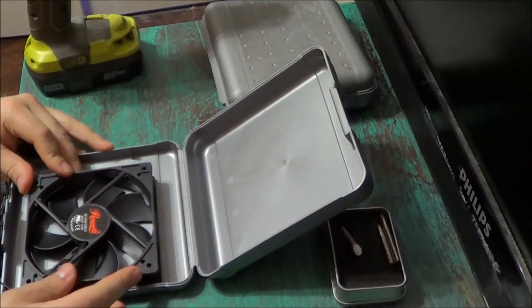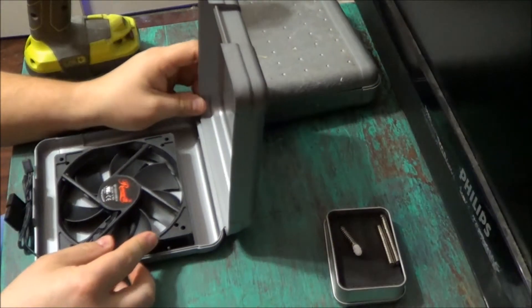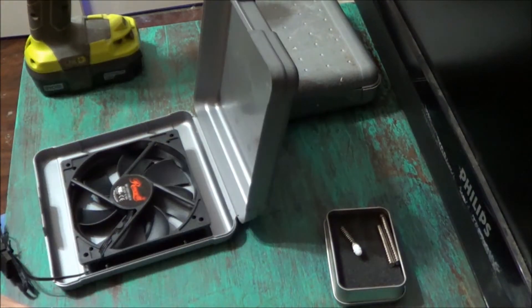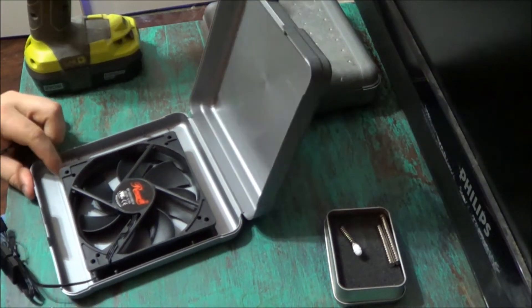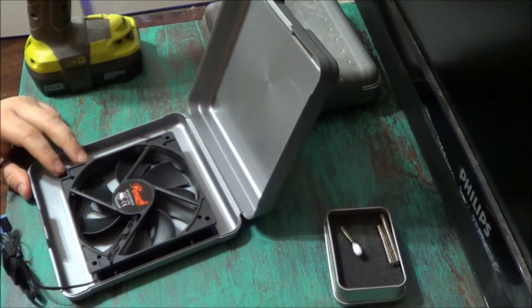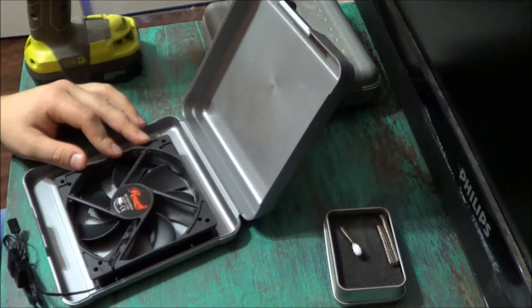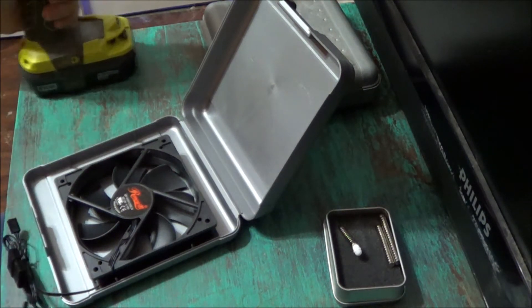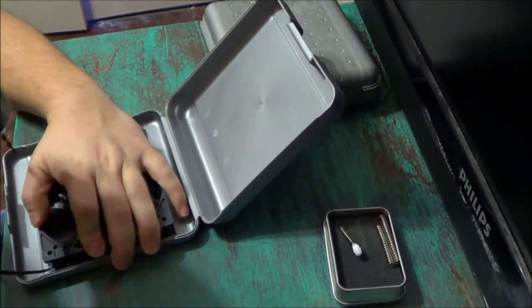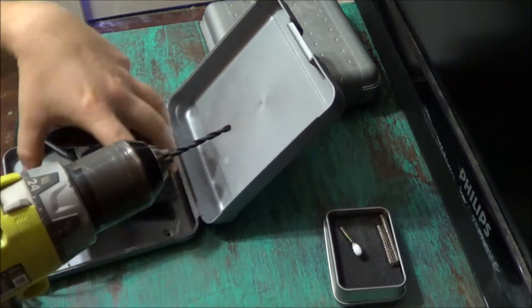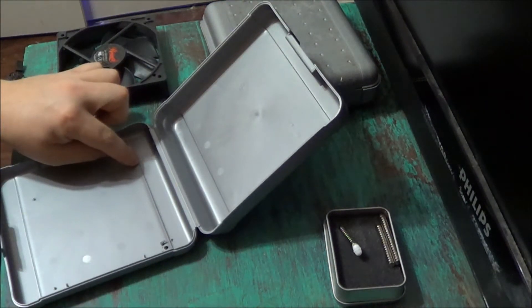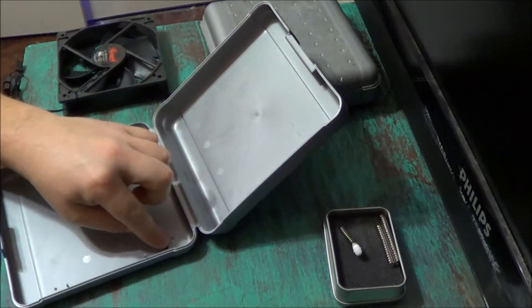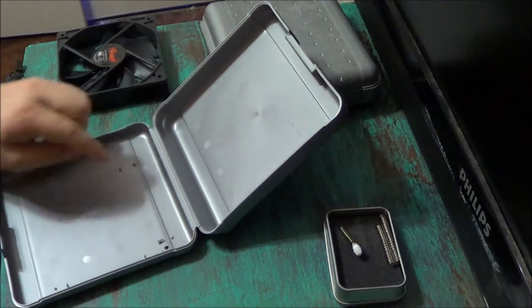I'm going to turn my box around here and I'm going to line my fan up the way that I want it to be. Now as far as the screws go for mounting the fan, this fan actually came with a pack of screws. I've already pre-sized the holes for the screws, which is a 5/32nd drill bit. Now that I have my pilot holes already pre-marked, this one actually went all the way through, but it's okay. Now I can actually finish drilling them through.